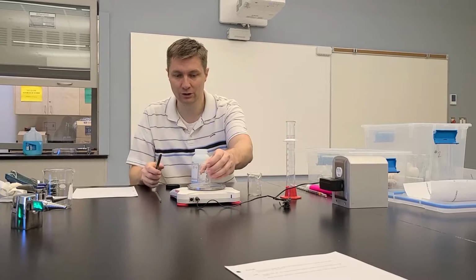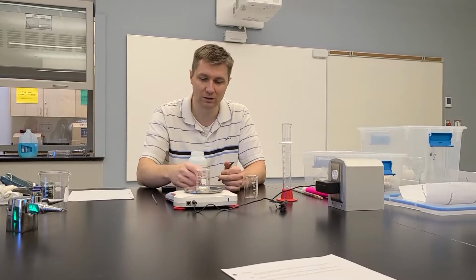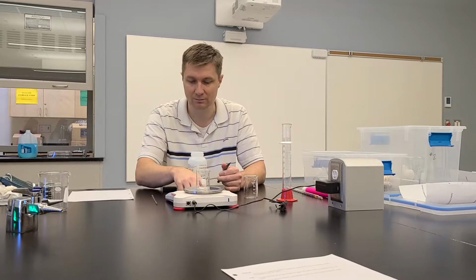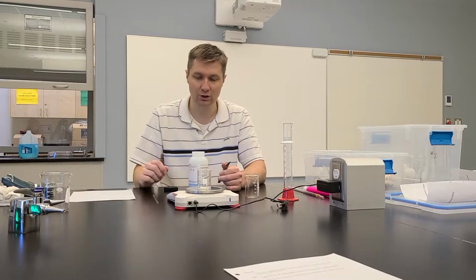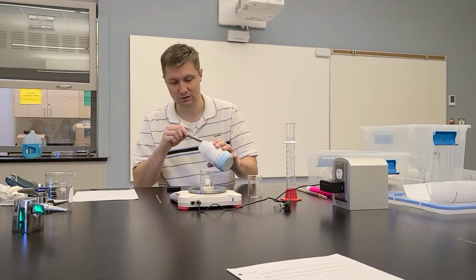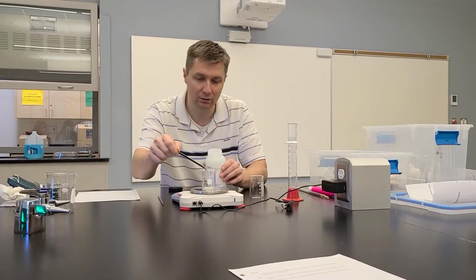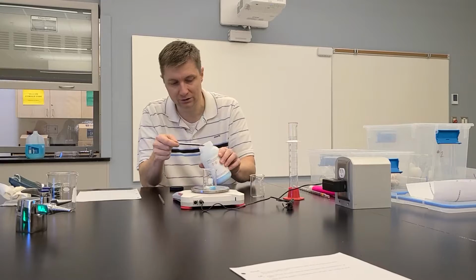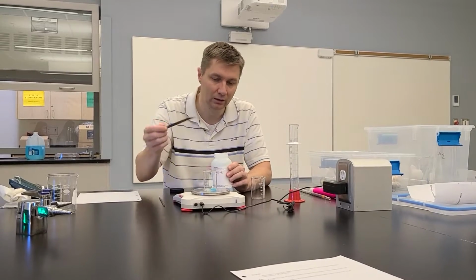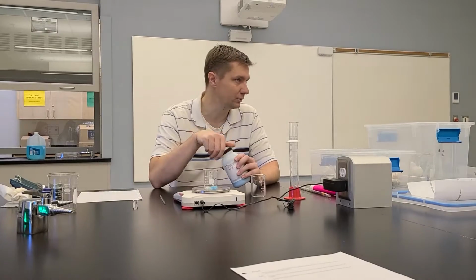So what you're going to do is take this beaker and just stick it on your scale. Use a small one so that it doesn't max out the grams on the scale. Hit the 0 button, so now it's at 0, and you just add in whatever the calculated amount is. When you calculate that amount, make sure that you check that calculated number with me so that you can be told, yeah, that's the right number, and you can start the dilution.